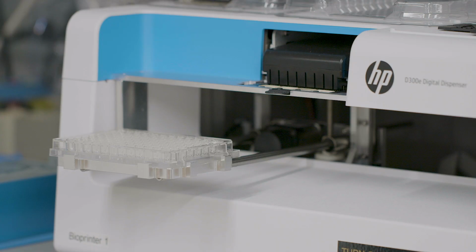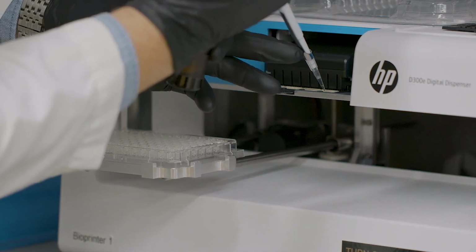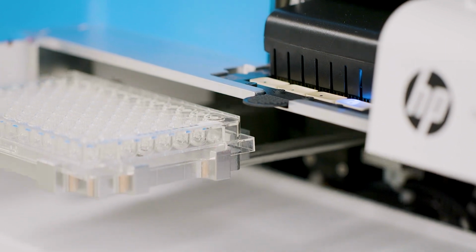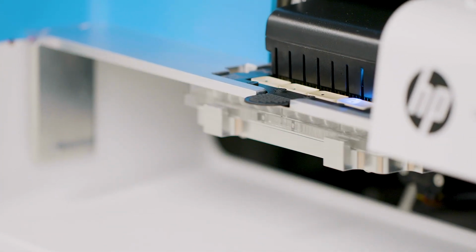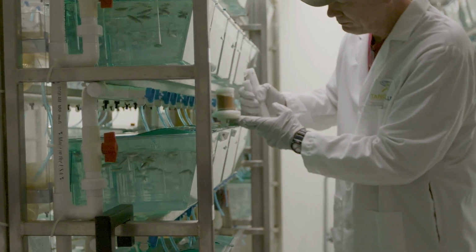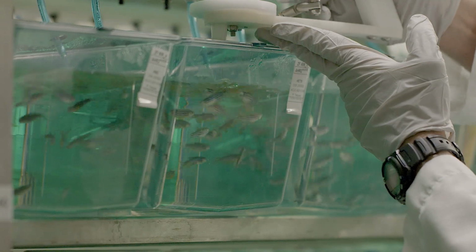Part of the challenges with high content and high throughput screens is that the data is very difficult to interpret. Many of the individuals that are involved in trying to develop safer compounds are scientists, but also non-scientists. They can include biologists, chemists, toxicologists, bioinformaticians, and other professionals that are not necessarily within the scientific community.